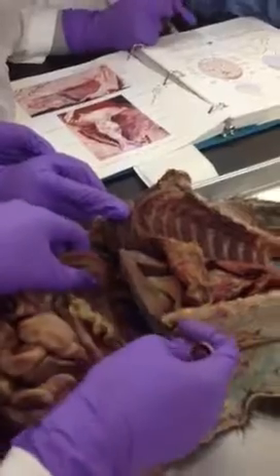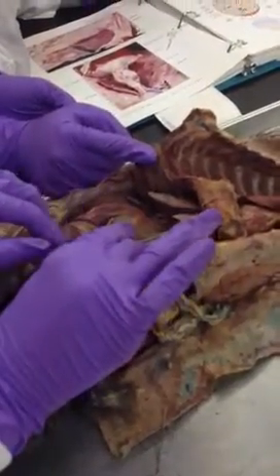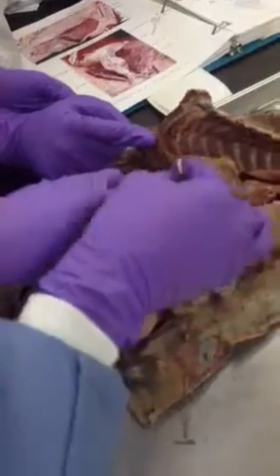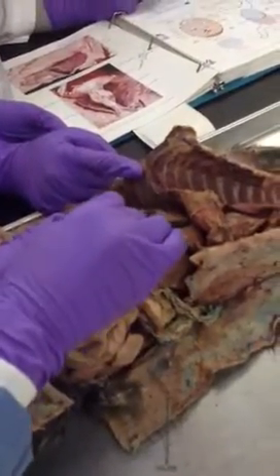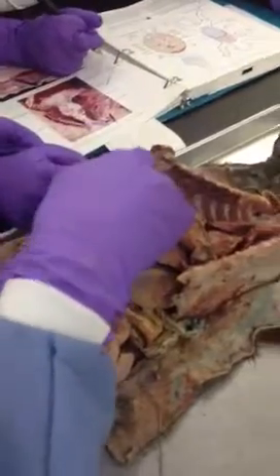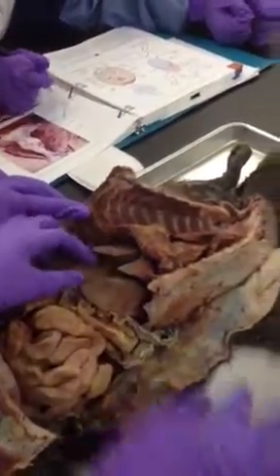All right, this is actually a continuation of caudate lobe here. This is the, what was this? Left. And then what would this one be? Left posterior. All right. So that's a 6. 1, 2, 3, 4, 5, 6. Left anterior, quadrate, right anterior, right medial, caudate, and the left posterior.